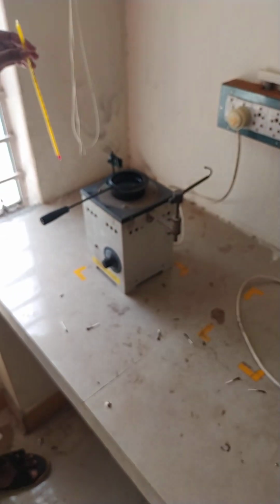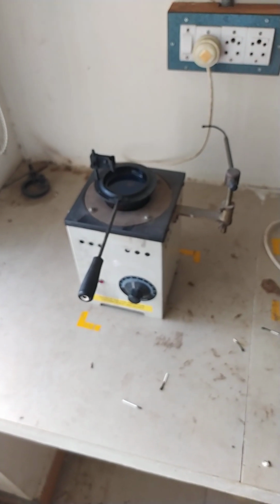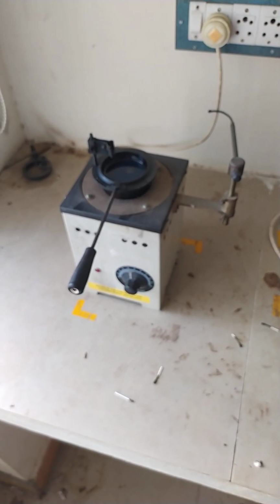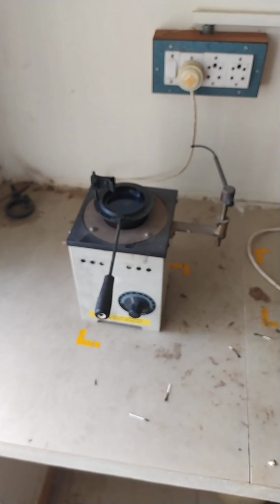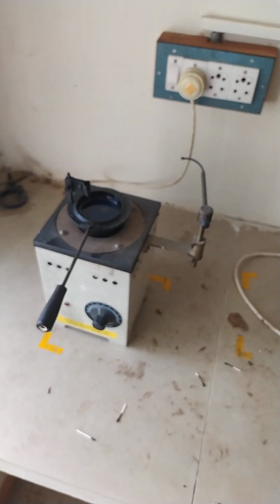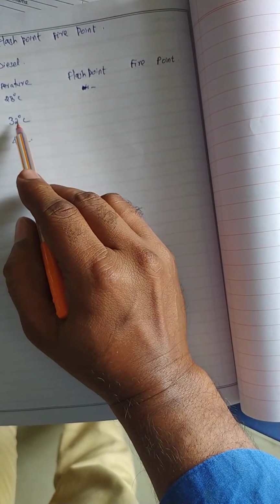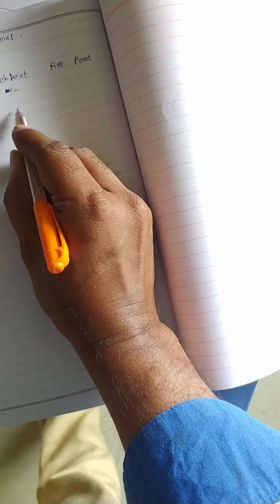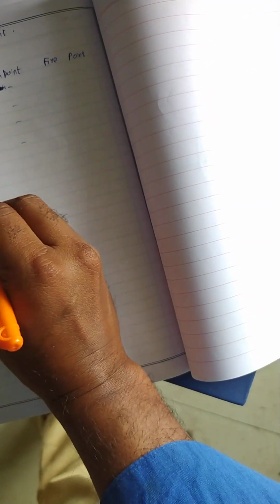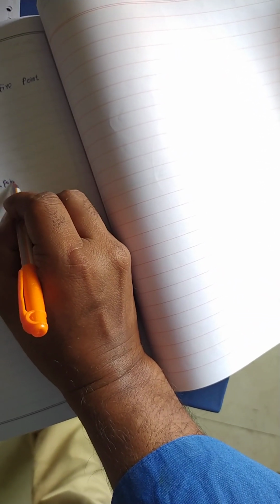These are all the readings we have to take for this experiment, the flash point and fire point of diesel. We are using pure diesel. The flash point is 58 and the fire point is 65. We have to note the readings in this particular table. I have to identify the initial temperature. There is no flash at 32, no flash at 40, no flash at 55, and no response. We also have to take another reading at 58, where some flash occurs, so the flash point is done.